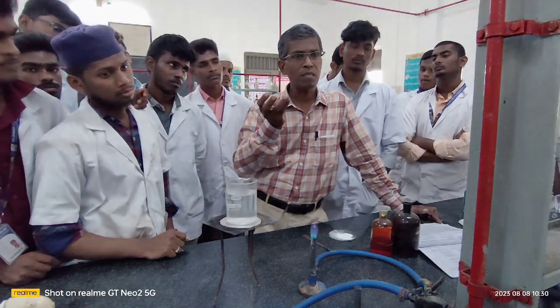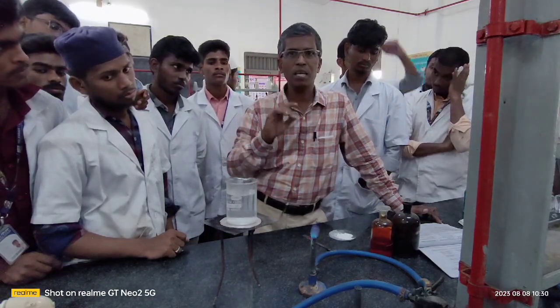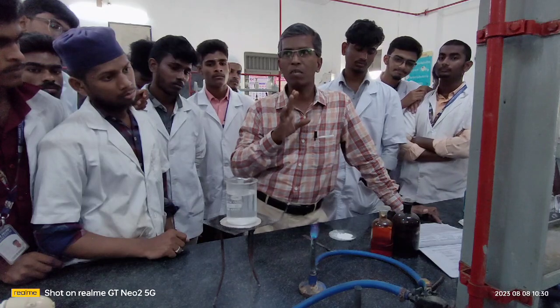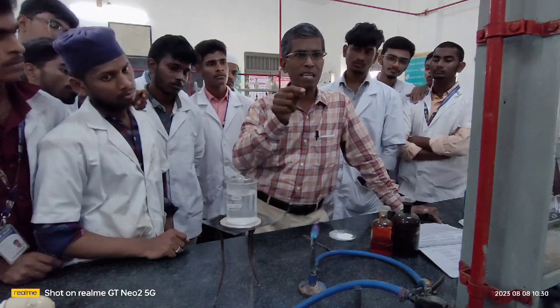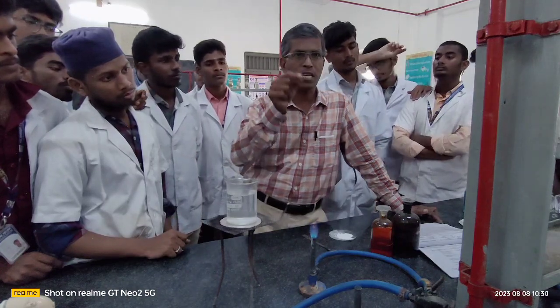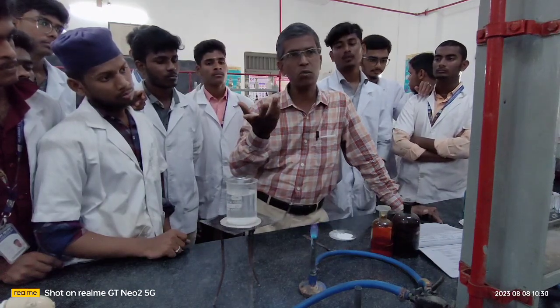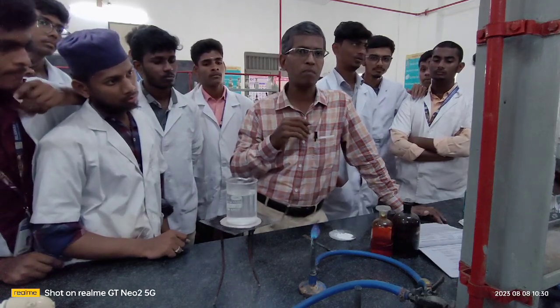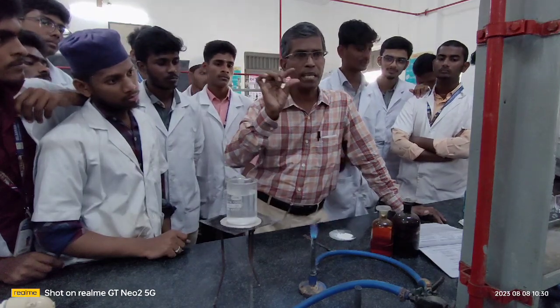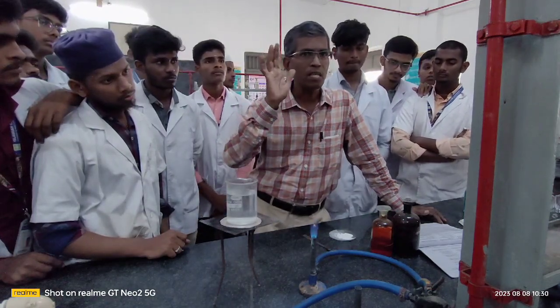Usually we have nitrogen, chlorine, bromine, iodine and sulfur usually given, and since at your level, that is the BSc level, we are not giving you the halogens in general, only the nitrogen. The presence of nitrogen you are confirming with the help of a special test called the sodium fusion extract test. I will show you very shortly how to perform this particular sodium fusion extract test. And after that, as usual, the presence of the functional group in the compound. So the confirmation of saturation or unsaturation, aromatic or aliphatic, and the presence of nitrogen or not in your given organic compound is very simple. I will show you one by one.